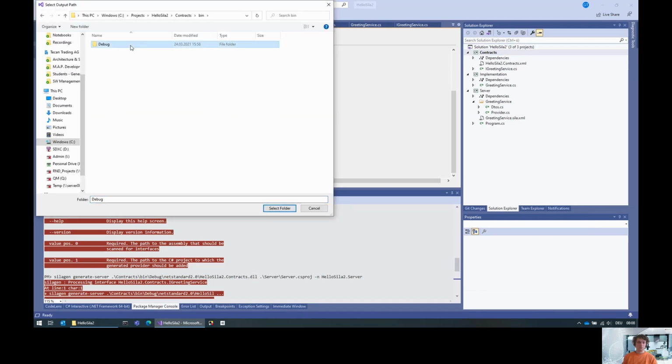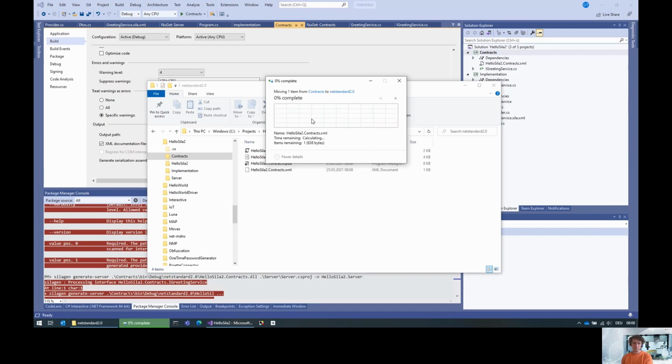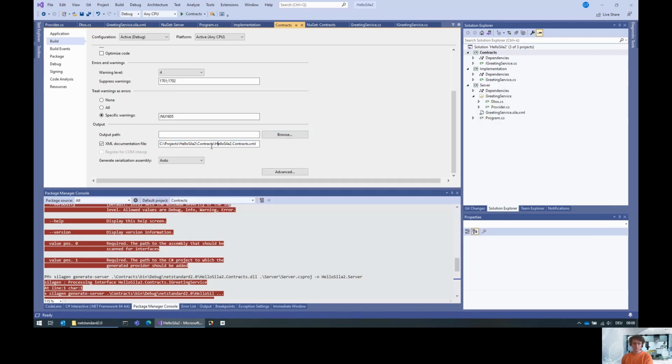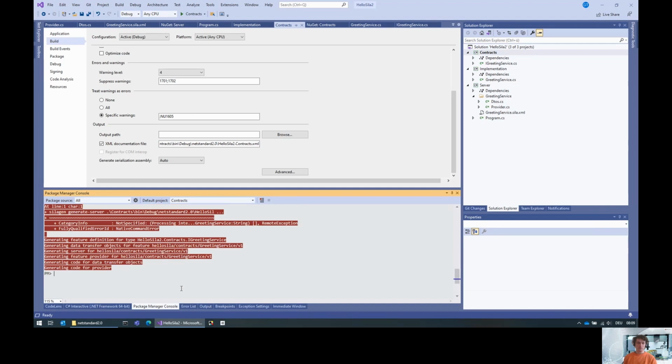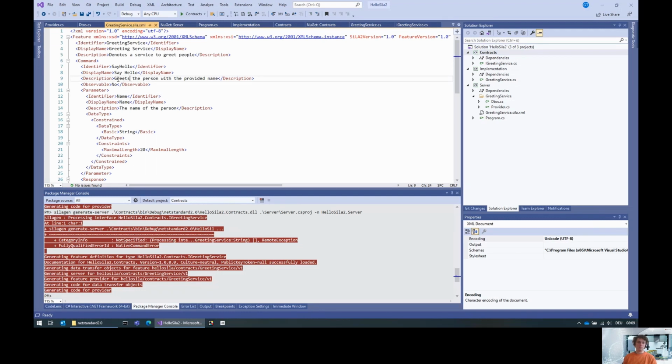Let's make sure that it's going to be so, the XML file always needs to be inside the same folder. Yeah, and then let's regenerate. And here you can see that the documentation for this assembly has been loaded successfully. And the result is that now we have also descriptions on the feature.